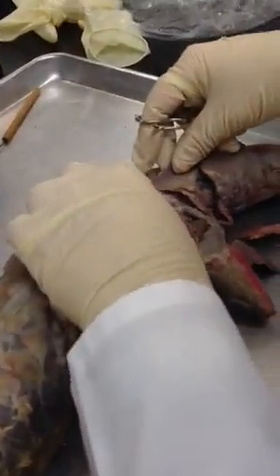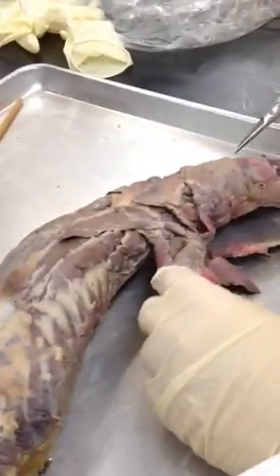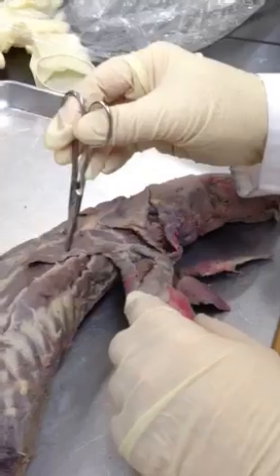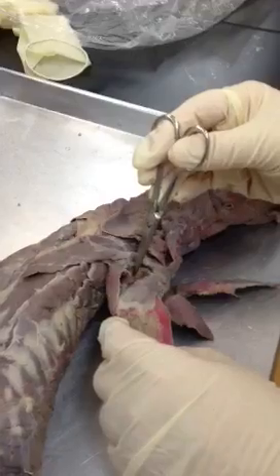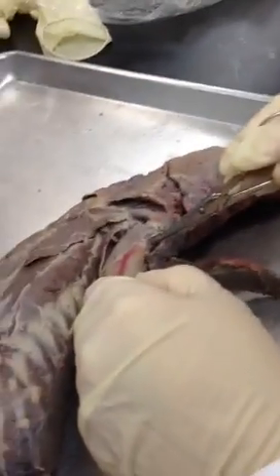Up here with the mink's head — let's put all these back the way they normally would have been. So we see three muscles here: clavotrapezius, acromiotrapezius, spinotrapezius. Also out here in the arm: dorsal epitrochlearis, triceps long head, triceps lateral head, brachialis muscle.